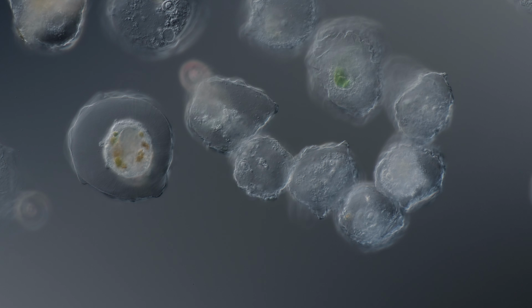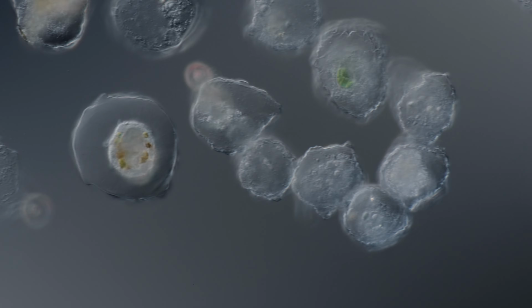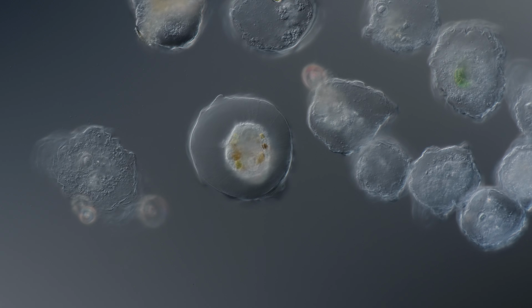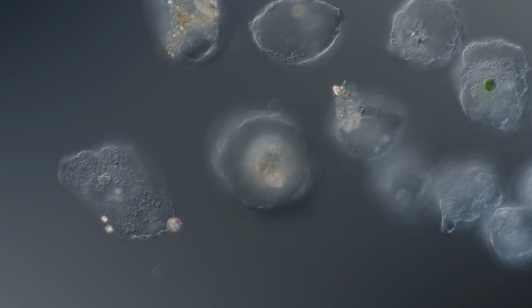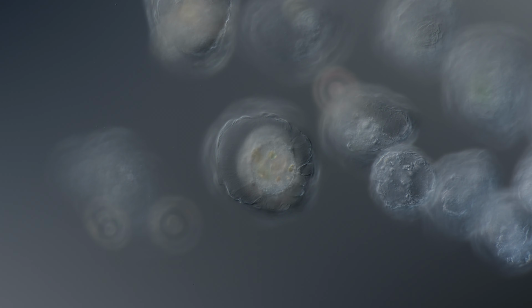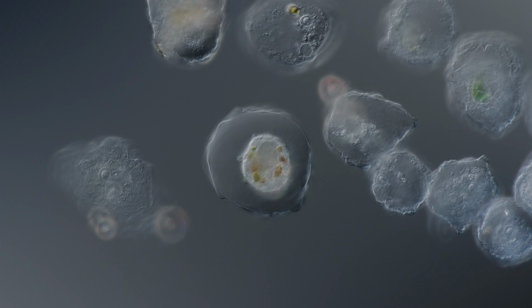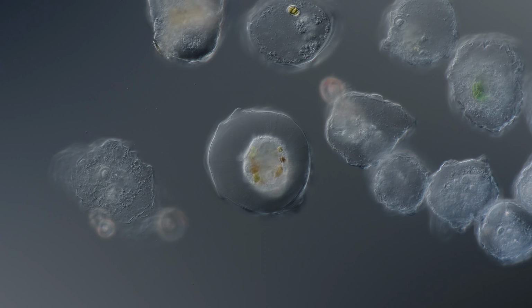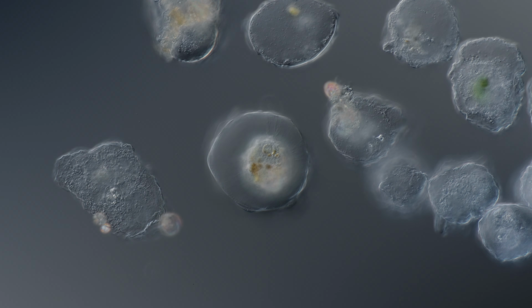This one also looks empty, but you can see there is the nucleus on the left. And again, wow, only hyaloplasm. Where's the nuclei? Somewhere here, I guess. Inside the food.